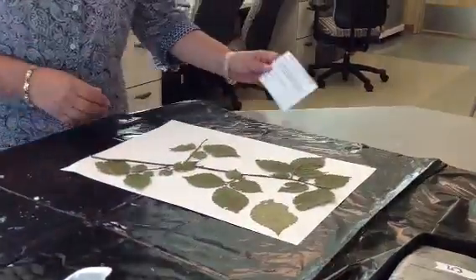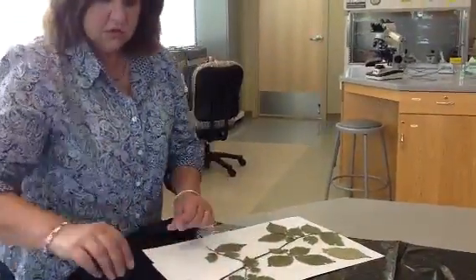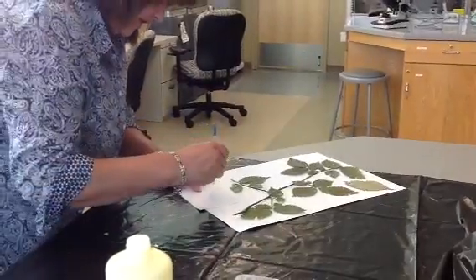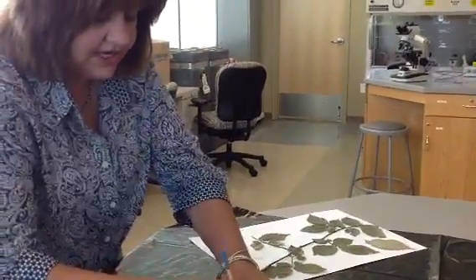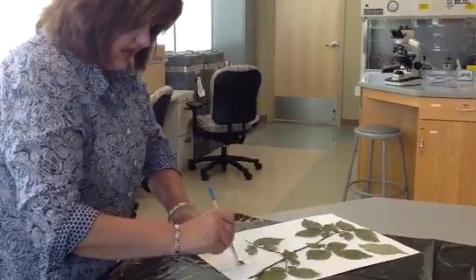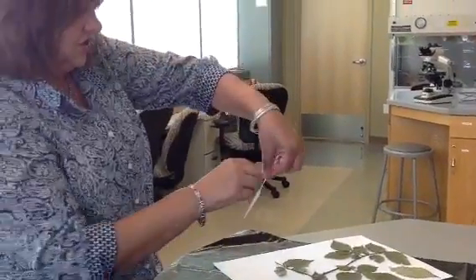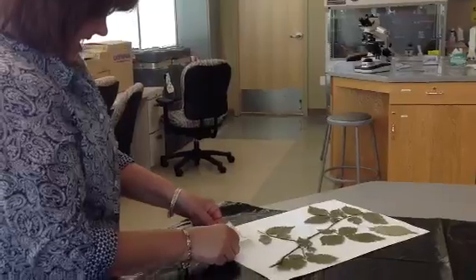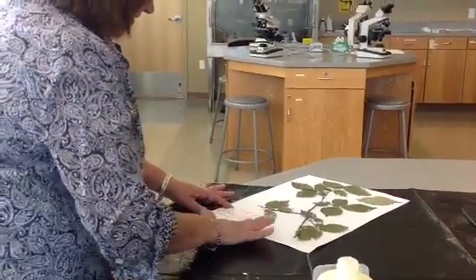Finally, I've left room on here to put the plant label. I can glue on the plant label with a little bit of remaining glue. This label is available on ANGEL in a folder that has herbarium resources — it has the name of the plant, and there's a blank template there for you to fill in the information. We place this sample label on the edge of the sheet.